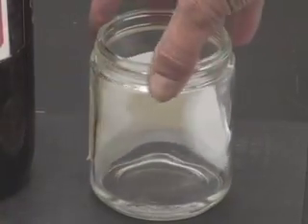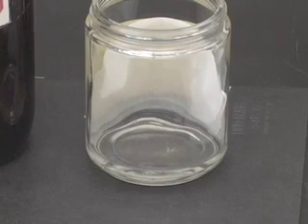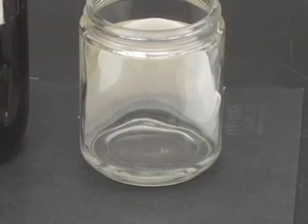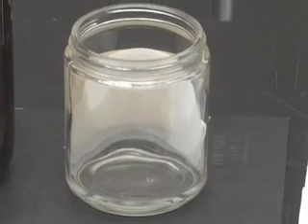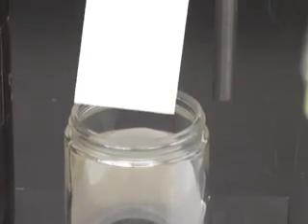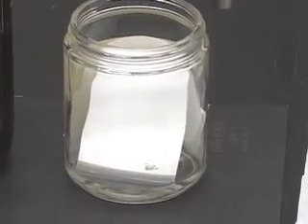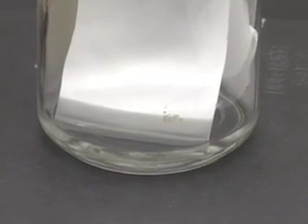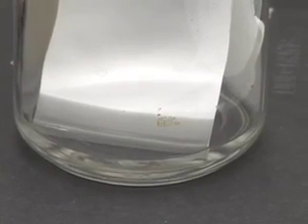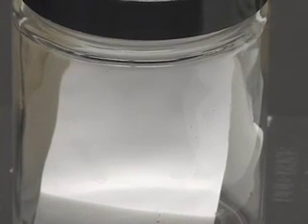I am going to turn the jar around so that when I put the TLC plate, I will be able to watch what is happening. Now I am going to insert my TLC plate carefully in the developing chamber, cover the developing chamber. Watch the solvent move along the plate and remember we want to remove the plate when the solvent front is about a centimeter away from the top edge of the plate.